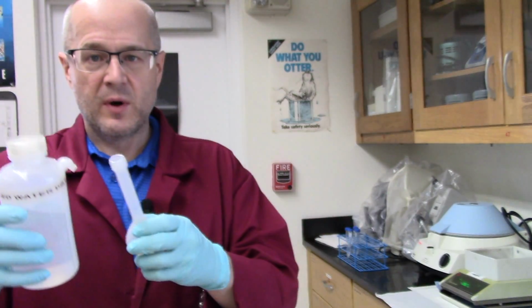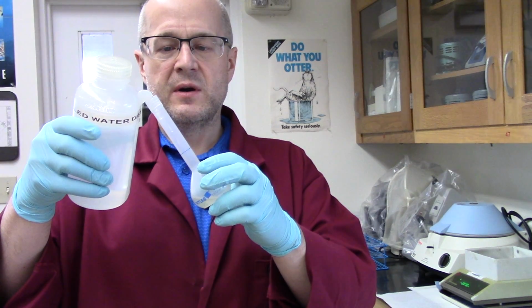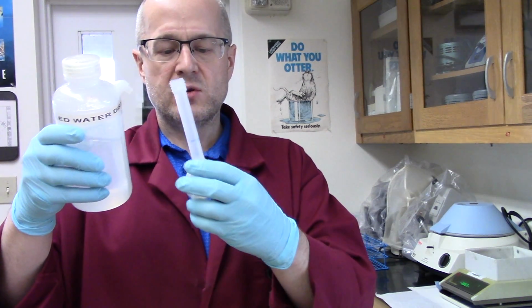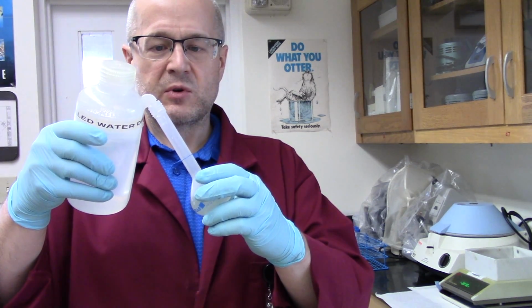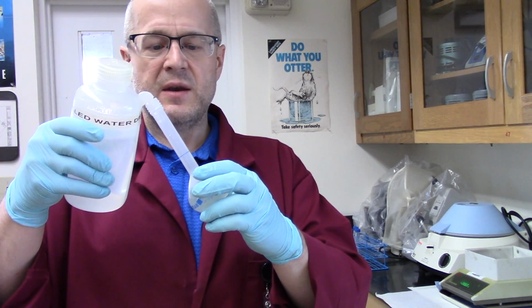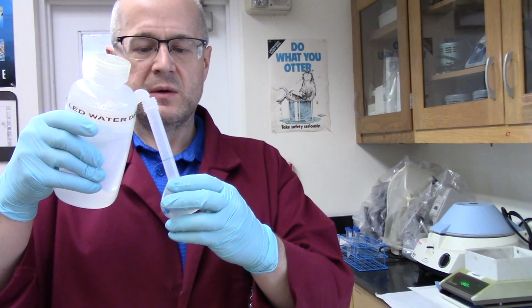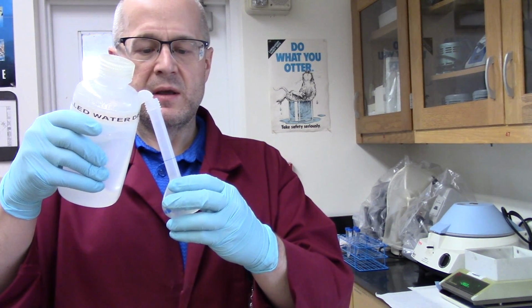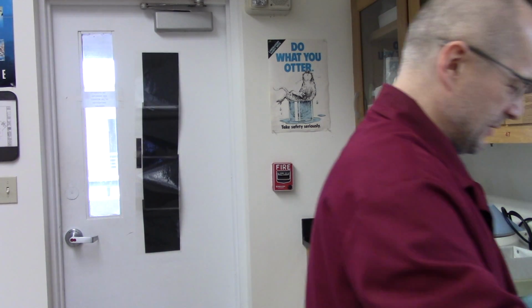So now with the water bottle, I'm going to bring the volume up to 50.00. Now as you get closer to that line, you want to stop using this crude little squirt bottle and you want to start using maybe a pipette. So I'm just about there. There we go. I'm going to start using a pipette because I don't want to have to refilm this video, to be honest with you.